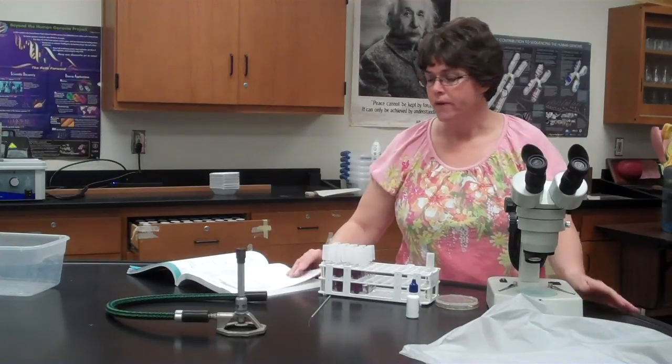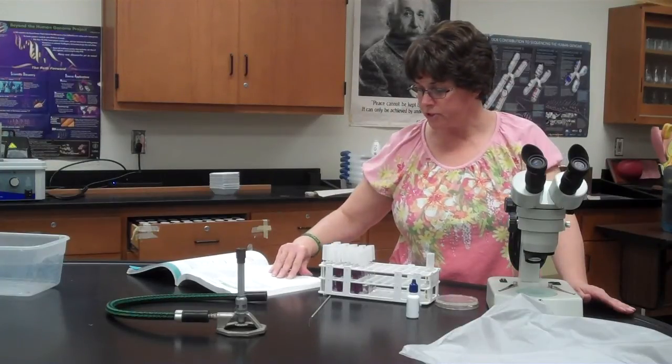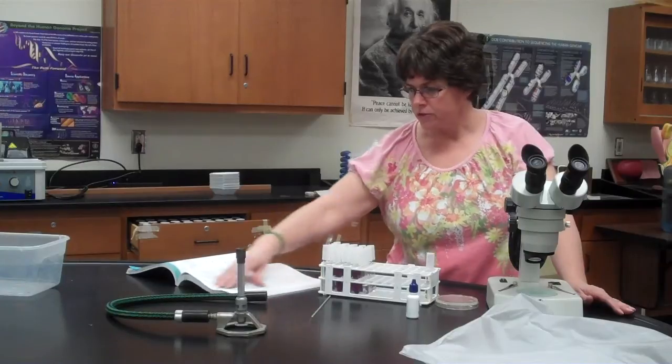I want each student to be able to identify them themselves, which means that when you go to identify them, you need to be able to tell what kind of spores they have, what kind of hyphae they have, whether they're conidiospores, whether they're sporangiospores. So you're going to be looking at those characteristics, whether they're septate or not, the different things that we talked about in class. Plus your lab manual has a key to follow to figure out which ones they are. There's the color of the colony and different things like that that you're going to use as characteristics.